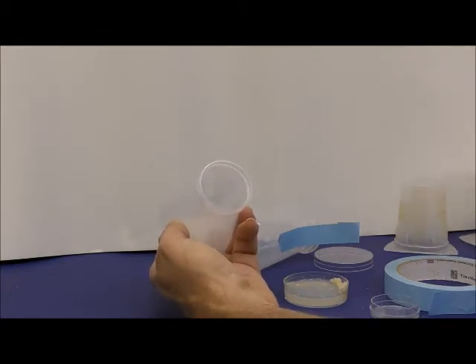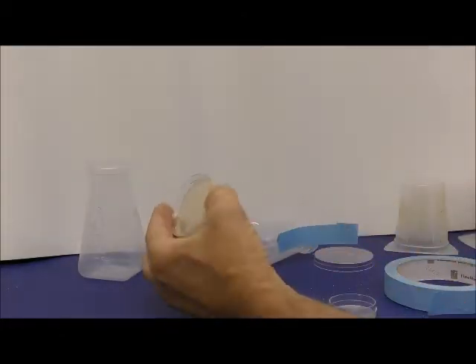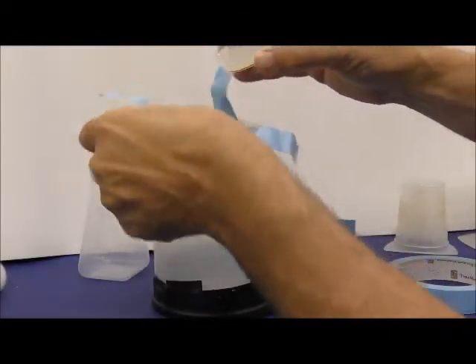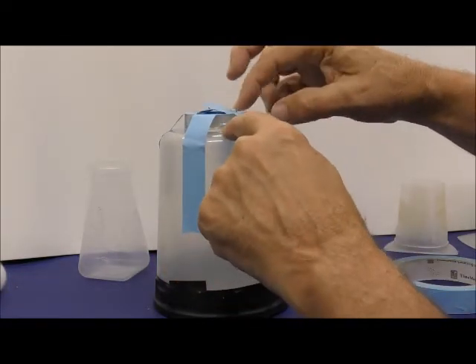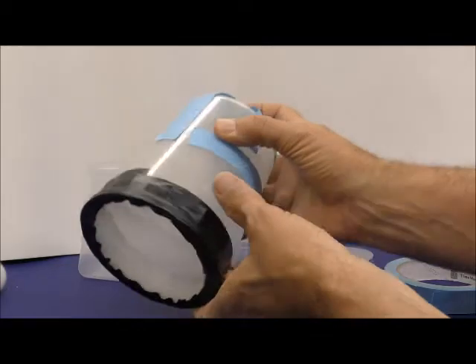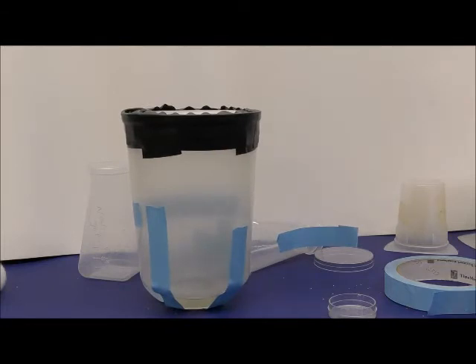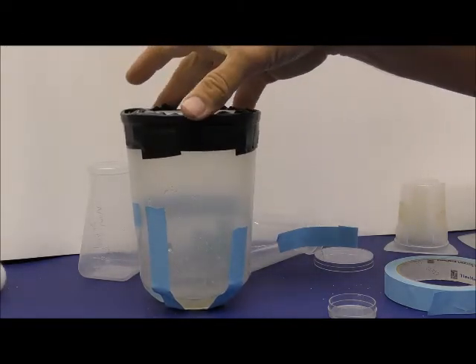You might be able to use the lid of those dishes, but they're pretty small, and you don't have much space for putting the apple juice agar in there. So those are different ways to make the dishes. And the apple juice agar in here, in food, will keep the flies alive between egg pulses. So I prefer this approach here, and it works pretty well. And just have to make sure that the tape is tight, because if there's any gap, the flies will get out. And then you set that to the side, mark your flies, and you can let that sit for the day or 2 days. It's also easy to add water through the lid onto the food if it's drying out. You can just squirt water right through there and water your food if it seems to be drying out.